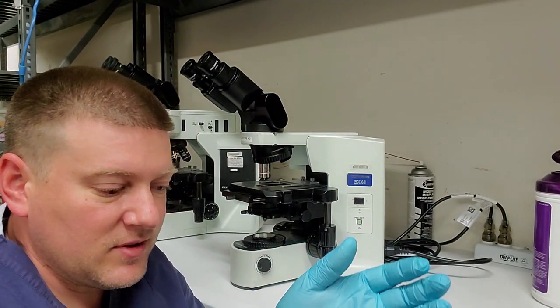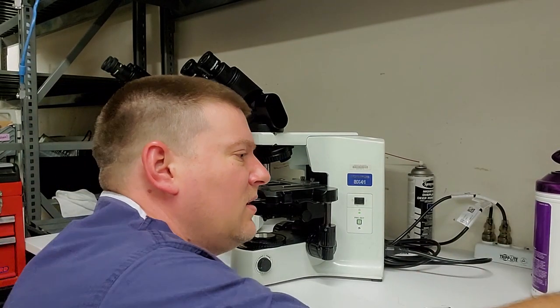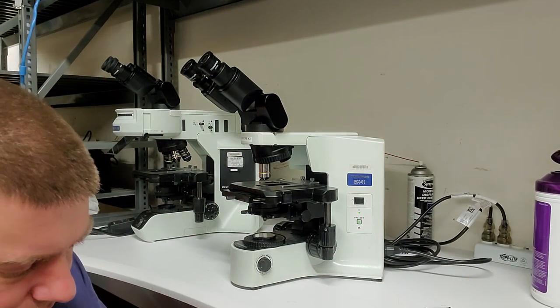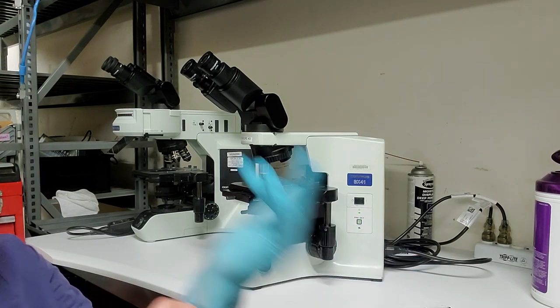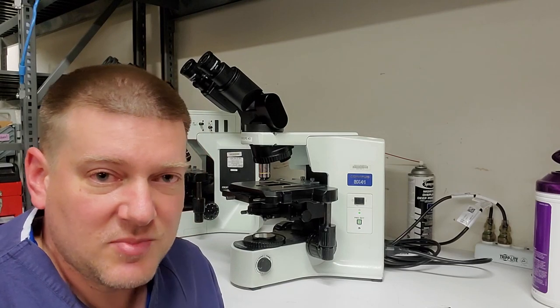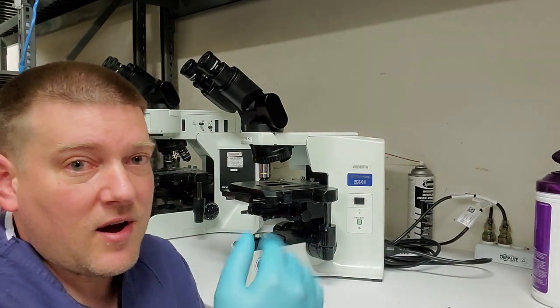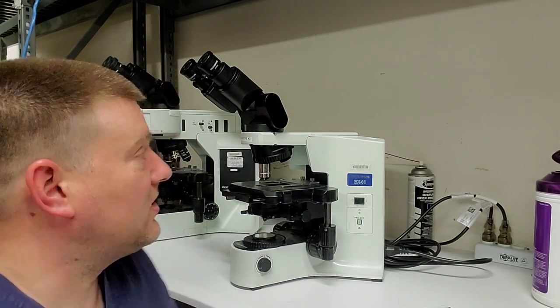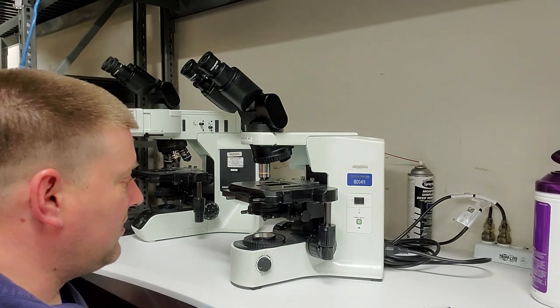Now before I get to the filter glass, because I was touching the ways and a few other things, let's go ahead and change out the gloves. That's why I have a whole box of gloves here, guys. Sometimes when I'm working on surgical microscopes, I can change my gloves 6 times throughout a PM easily, just when I'm cleaning the optics, because as soon as they get contaminated with anything, you should change them out because you don't want to cross-contaminate. So I've got another Zeiss wipe here.